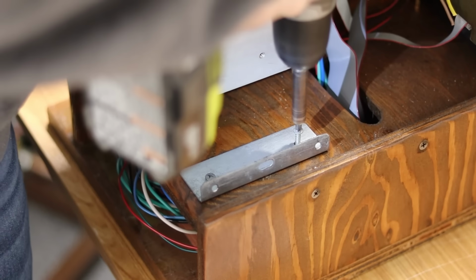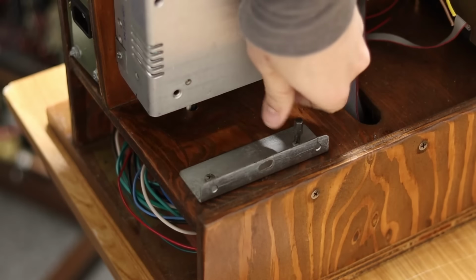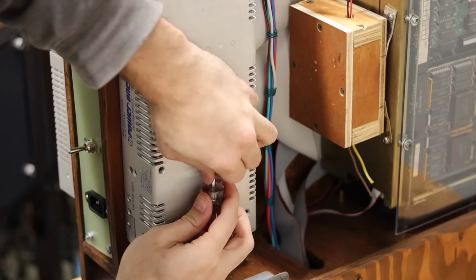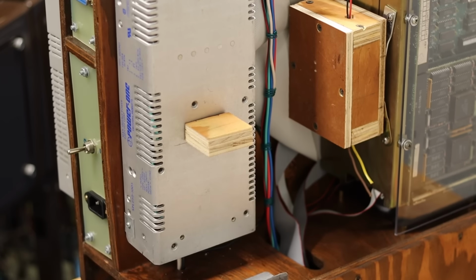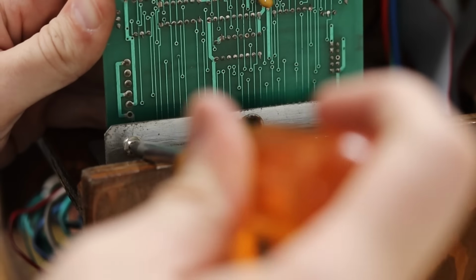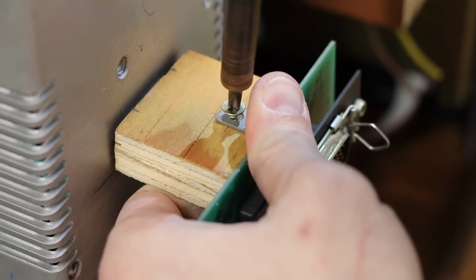To mount the opto-isolator itself, I'm just going to temporarily bolt it to the side. I'll screw down a little bracket that'll hold the bottom of the opto-isolator board. Then I'll mount a small chunk of wood further up that'll give structure to the top. 2 screws in the bottom to hold the opto-isolator in place, then a little tab up top, and that should get the job done for now.